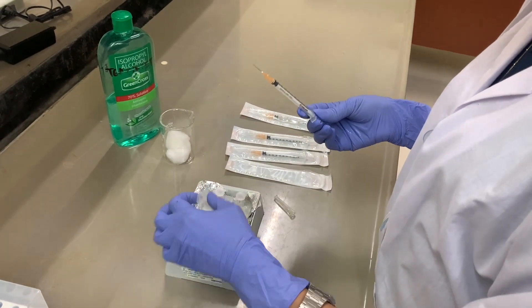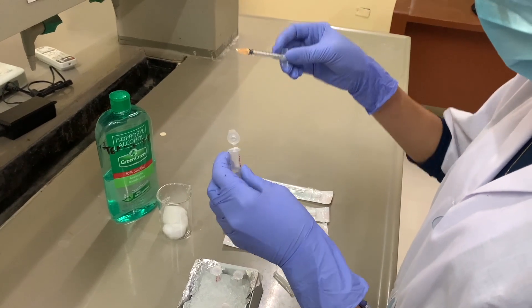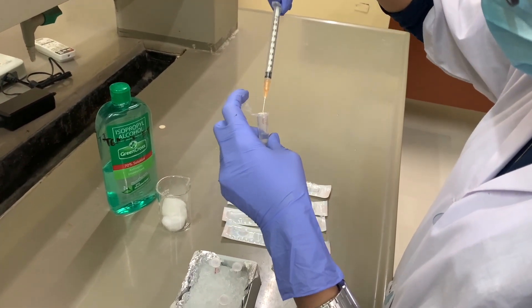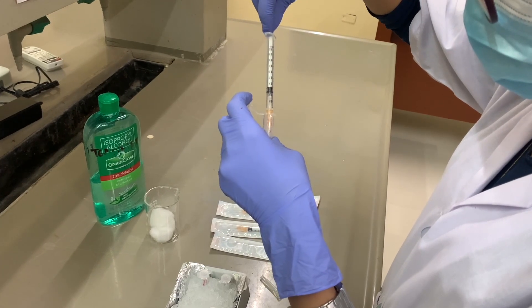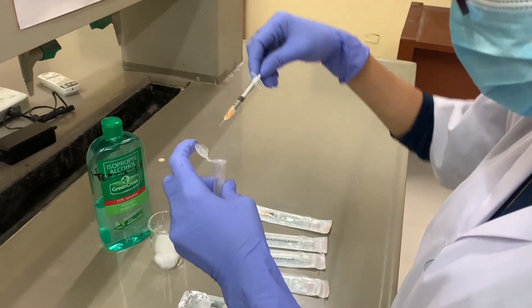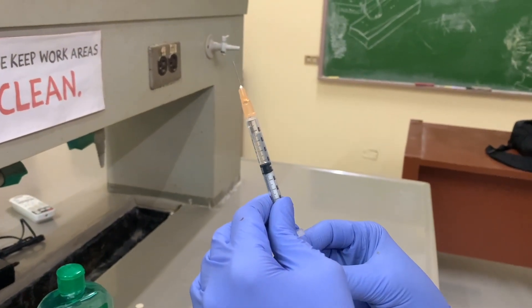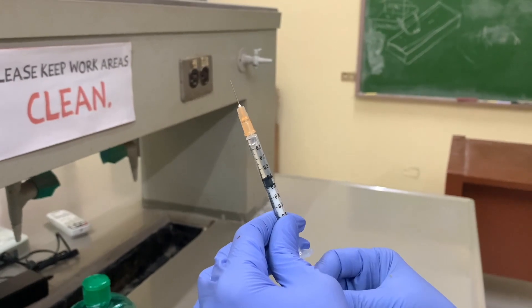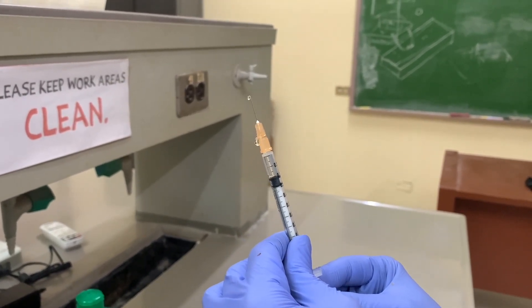Place 200 microliters of anticoagulant solution in a 1 mL 26-gauge tuberculin syringe. Anticoagulant is used to prevent clotting of the hemolymph and is ideally used at a ratio of 1 part hemolymph to 2 parts anticoagulant or 1 part hemolymph to 3 parts anticoagulant. In this activity, the hemolymph to anticoagulant ratio will be 1 to 2.